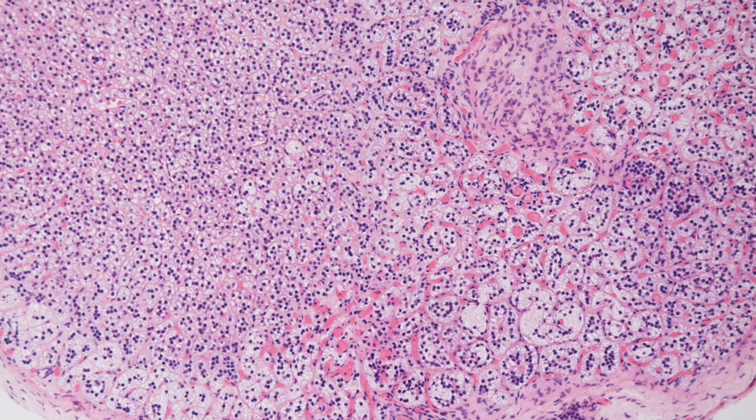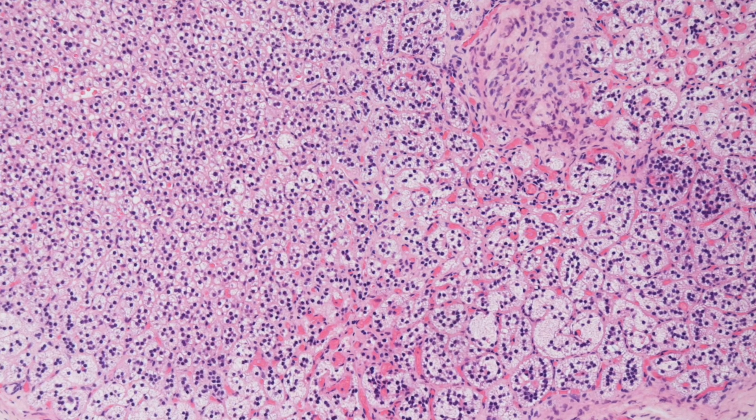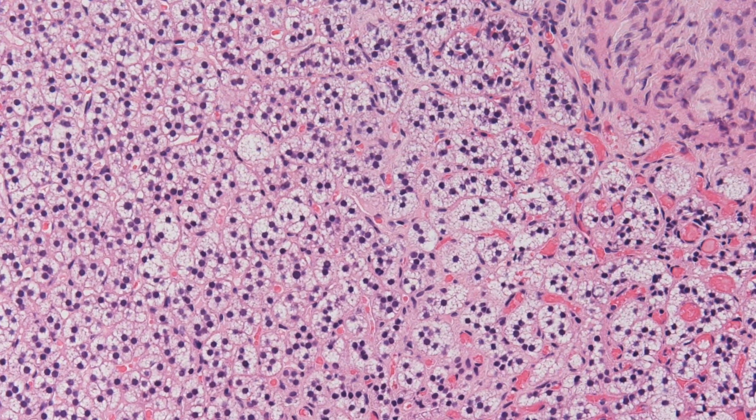On higher power, you can see the normal histological features of adrenal cortex in the adrenal rest.